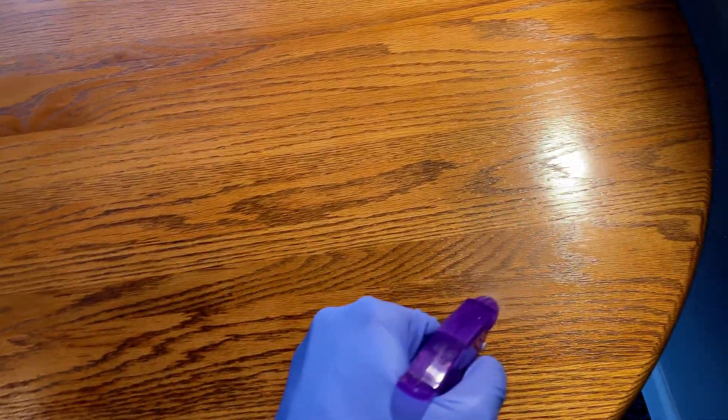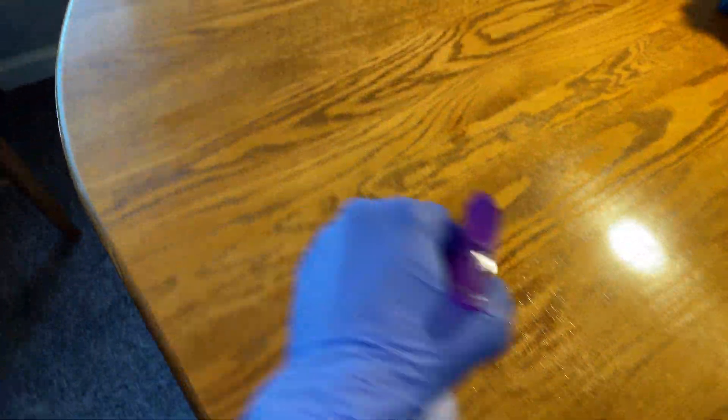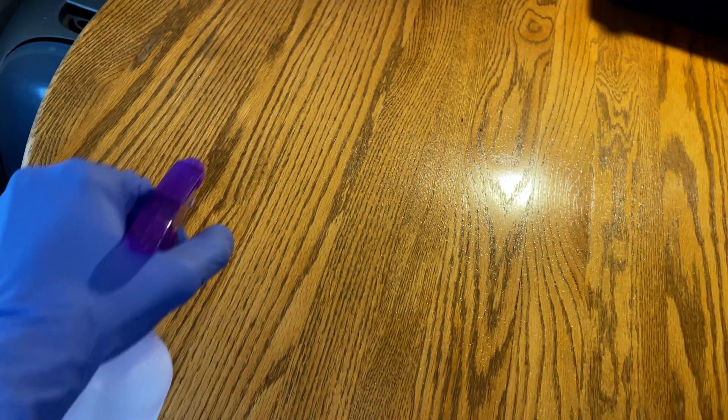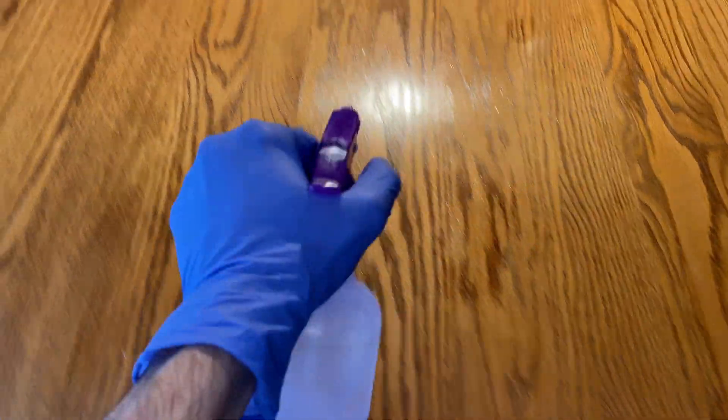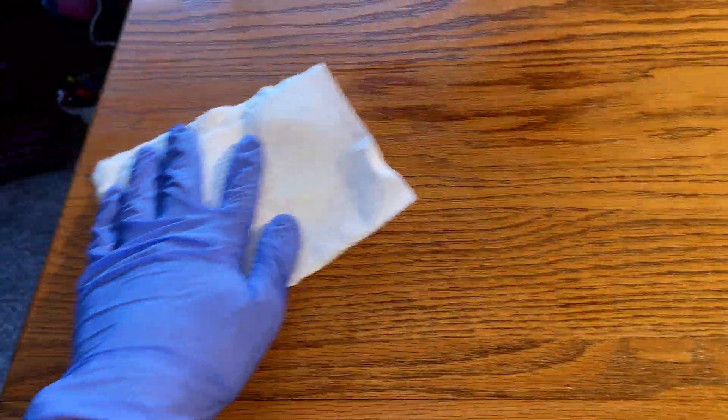Today, we are going to go over how to clone your fruit for increased yield, confirming traits, or even just getting bins of mushrooms that resemble the fruit that you had cloned. This isn't a key step to mycology, but it does progress your grows to better adapt to your conditions along with help you get some pretty cool fruits.